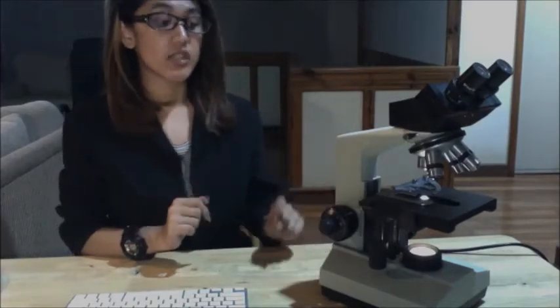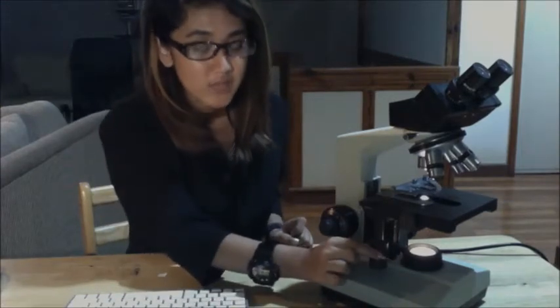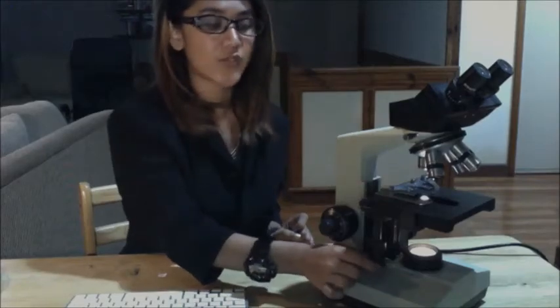If the specimen on the prepared slide is not centered over the hole in the stage, make use of the stage adjustment knob. So this is your stage adjustment knob. The top stage adjustment knob moves the slide forward and backward, and the bottom stage adjustment knob moves the slide from side to side. Also note that there are micrometer readings to indicate the position of the stage in both dimensions. It is found on your stage. This is useful when looking for the exact location of the part of your specimen that you want to focus on.